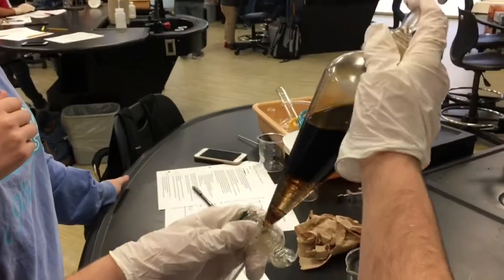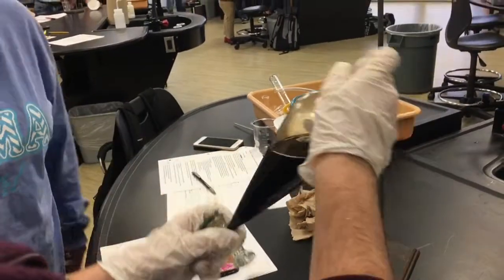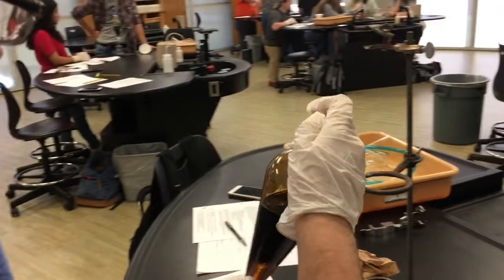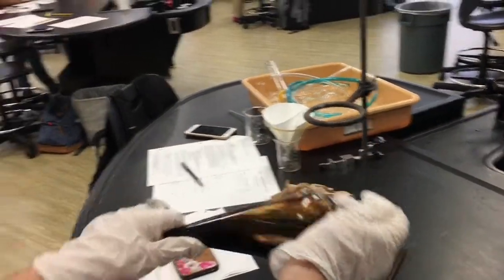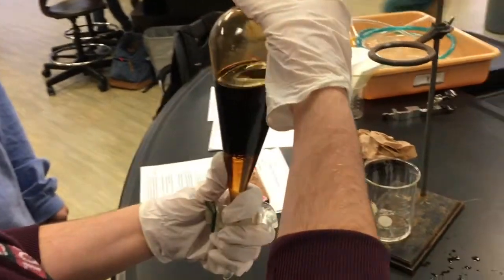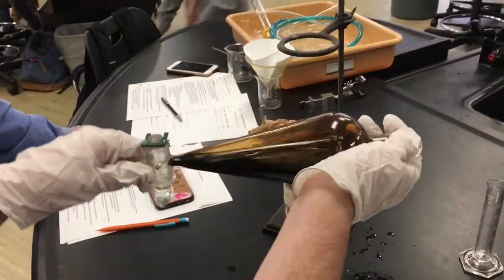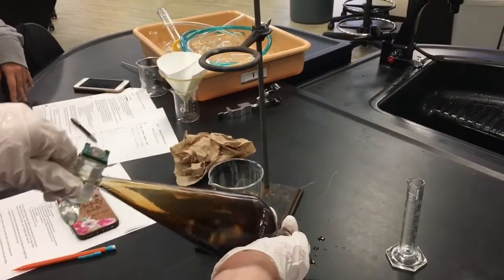Hold the top, and then just shake it around — like you're mixing an alcoholic drink. This is how you do it. Yeah, I have tons of experience. You've got to make this go back through it. You've got to turn it upside down enough where that will go in and out of it several times. Just don't turn it into an emulsion and you'll be good to go.